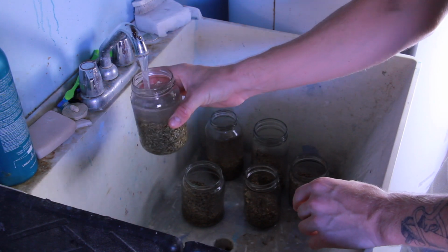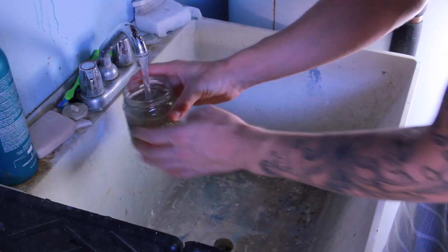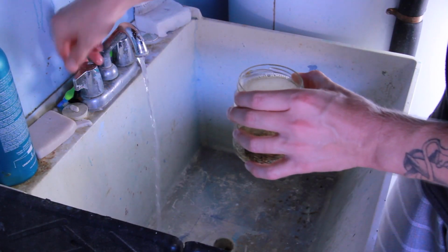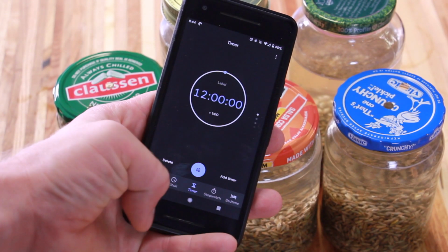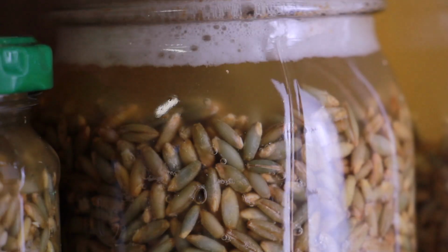Using hot water helps germinate any spores or bacteria that are already in the grain spawn, and that helps it die off easier when we boil it later. I let the jars soak overnight for about 12 hours. And here we are the next day.